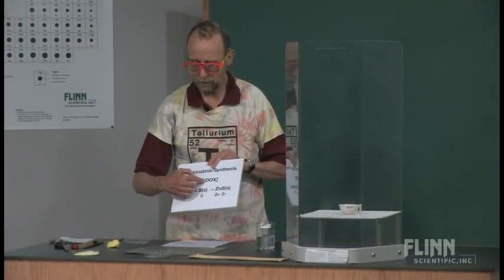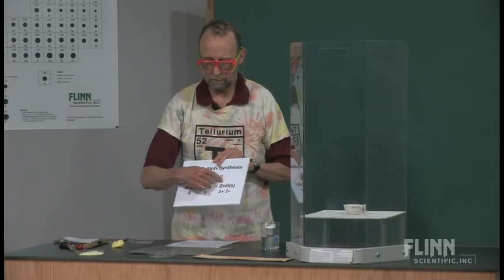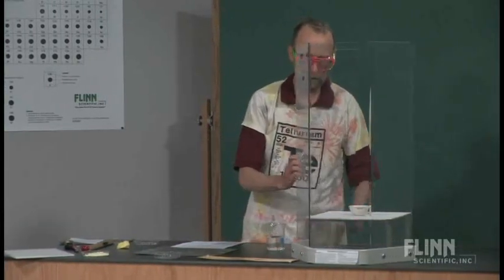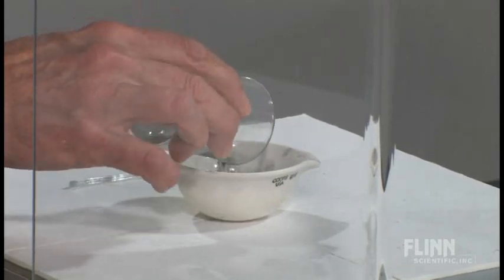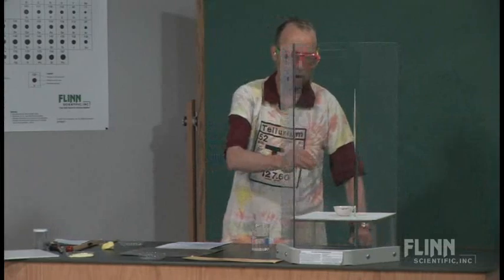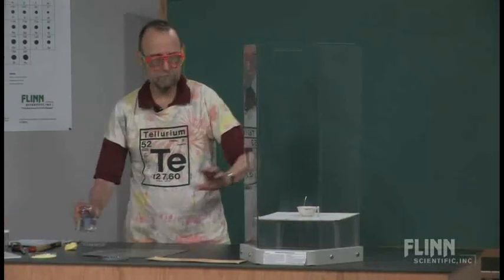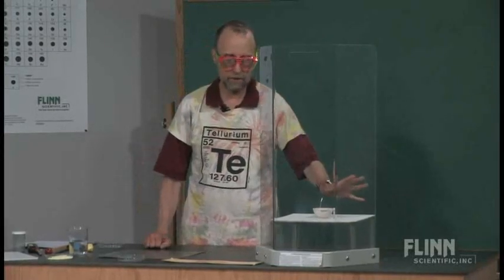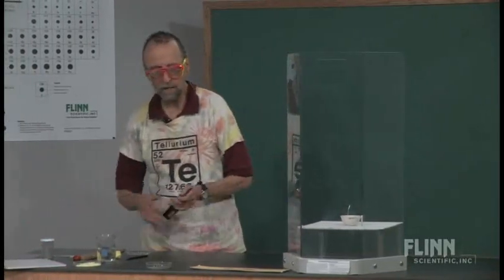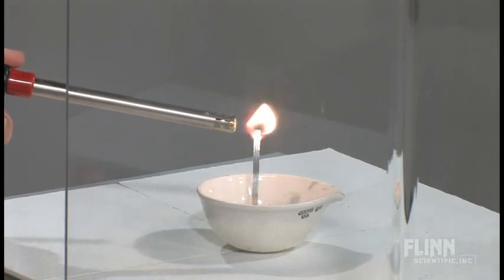Again, the electrons go from the zinc to the sulfur. Zinc is oxidized, sulfur is reduced. We form this compound, zinc sulfide. Because the electrons are transferred, we form a bond. So, let's go ahead and do that. I'm going to put in the mixture. Now, I have to heat that up to get it started. To do that, I'm going to take a piece of magnesium and use that as a fuse so that I can go away quickly. Let me bury that in there. Now, keep in mind, we have trillions and trillions of atoms of zinc, trillions and trillions of atoms of sulfur in the stoichiometric ratio. We're going to ignite that, and then I'm going to disappear. And you can watch this, and we might even be able to see it in slow motion afterwards. At some point in time, they may be able to do it in slow motion. If we get the lights down a little bit, I'm going to leave now.